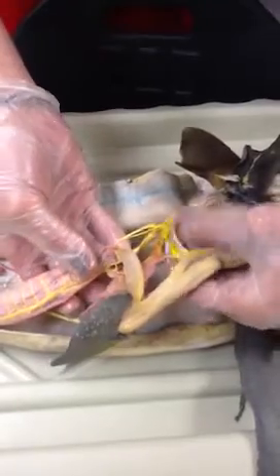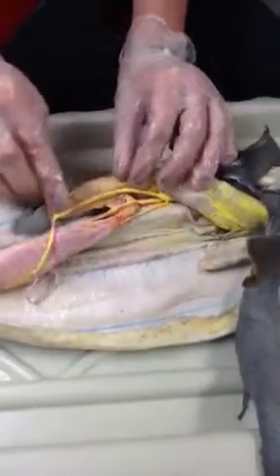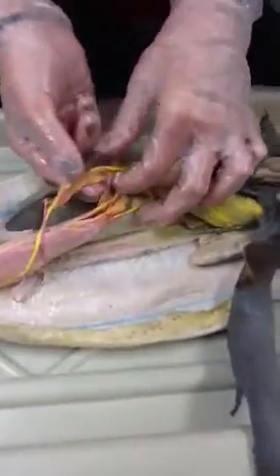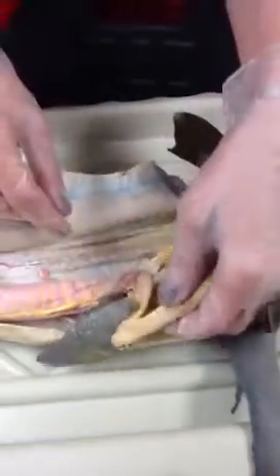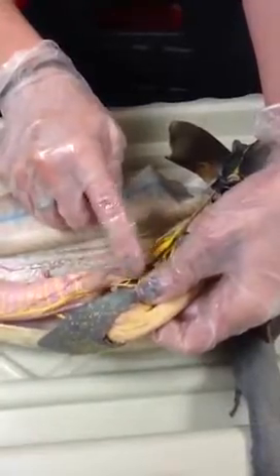So as you can see, this is our stomach with our gastric. This is going to be our spleen. Coming down here, our hepatic portal vein is going to continue into the lienomesenteric vein, which is on the dorsal lobe of the pancreas. And we will see our ventral lobe of the pancreas that actually sits on top of the intestines. So we have our lienomesenteric here.